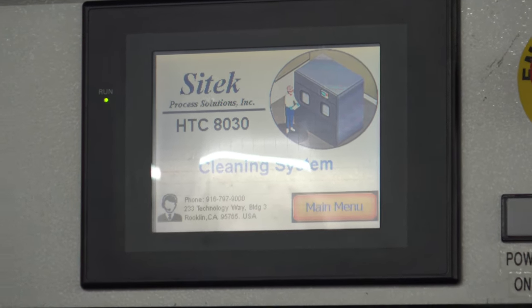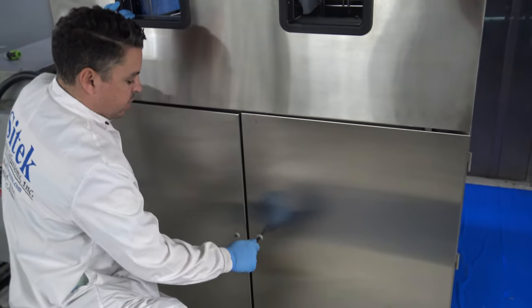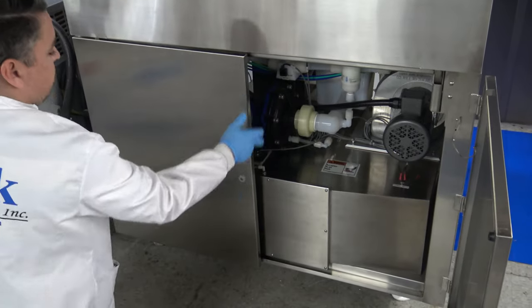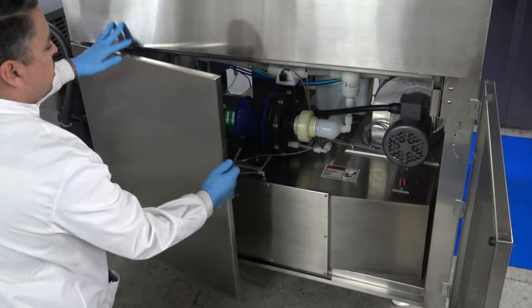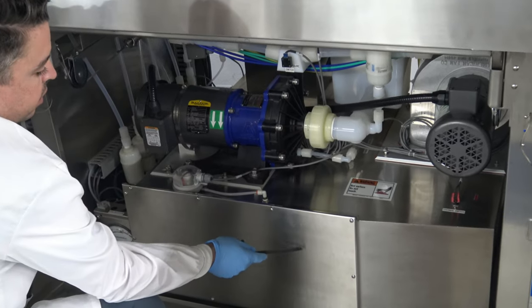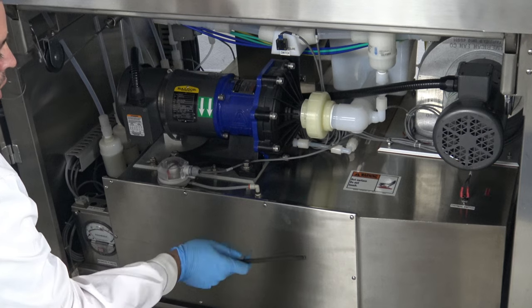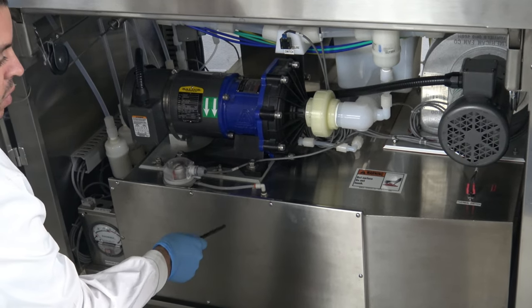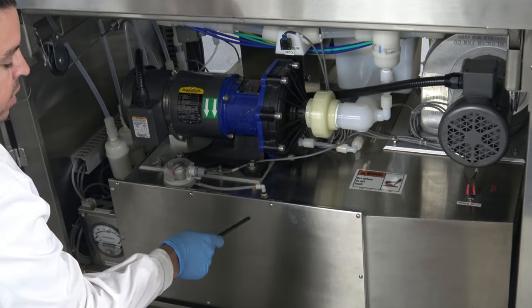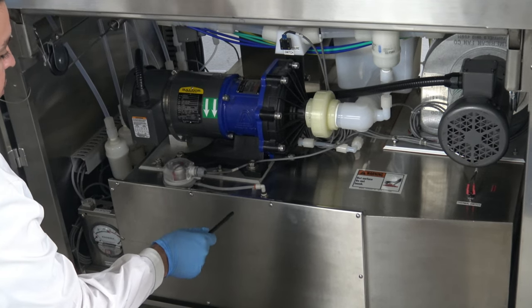The next item I want to do here is get down and show the underneath chassis part of the system. Under here we have several components. Starting underneath — which is closed up right now — we have a heater coil, a pre-filter, and a HEPA filter. The heater coil was tested out. The entire area was chemically cleaned from any debris or otherwise that we would find in the system. The pre-filter and the HEPA filter were both replaced.